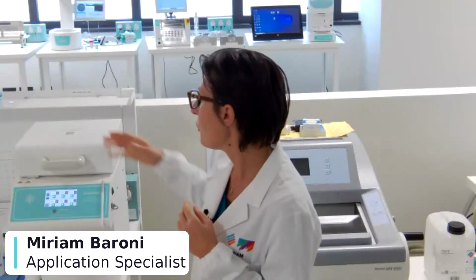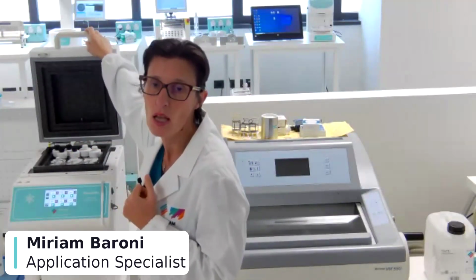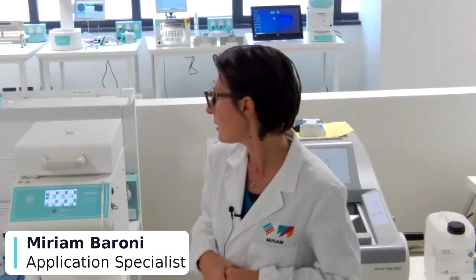Another reagent that we use in the PrestoChill is ethanol to clean the mold between two different samples. So before doing a freezing, we suggest to clean the mold well with ethanol, with the paper, and moisten it with ethanol, in order to avoid cross-contamination between samples, and also to avoid the presence of frost inside the mold.